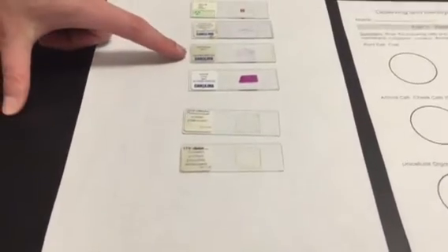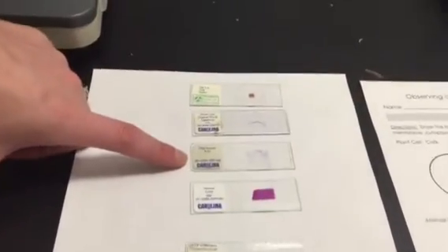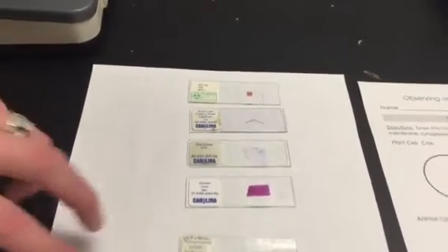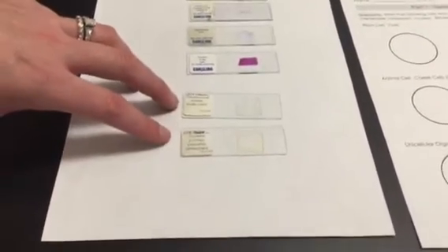So when you look at these on the oral smear, they're going to look purple, which are cheek cells, but cheek cells really aren't purple in real life. So looking at these 2, the unicellular organisms, they're going to be the most difficult to see under the microscope. So I'm going to talk about how you're going to be able to see them the best.